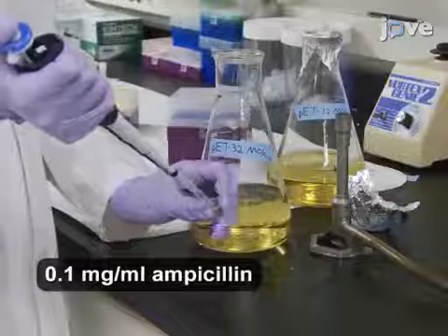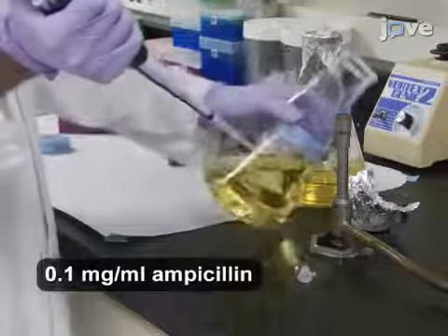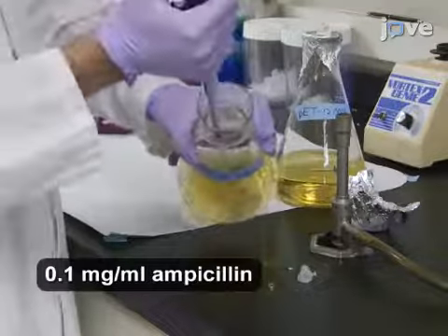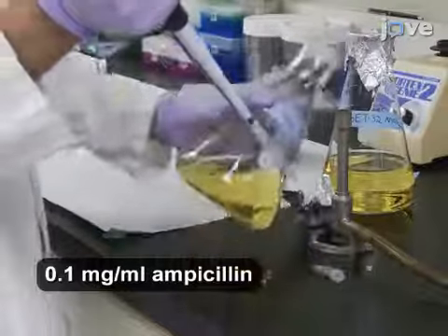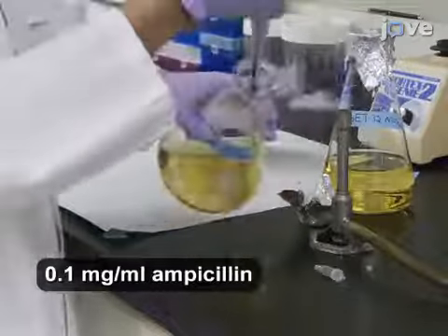Add 500 microliters of 100 mg per milliliter ampicillin to each of 2 500 milliliter flasks containing 500 milliliters of sterile LB. Transfer 1 milliliter of the overnight culture to each of the 2 flasks of LB broth.